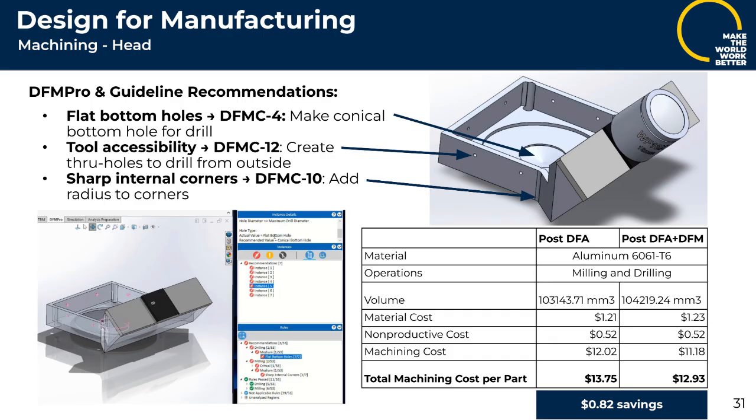The updates include replacing the flat bottom holes with conical bottom holes, and also making the small holes around the edge through holes to help with tool accessibility. Rounds were also added to the internal corners. Some impacts to the design are that the small through holes negatively impact the overall look of the microscope, and could introduce an area for dirt to accumulate. But from these improvements, the machining cost decreased, which had an overall of 82 cents in cost savings.